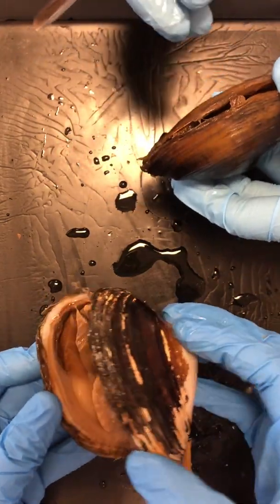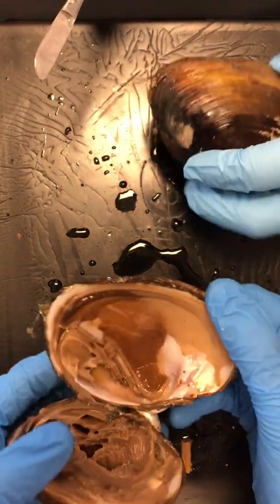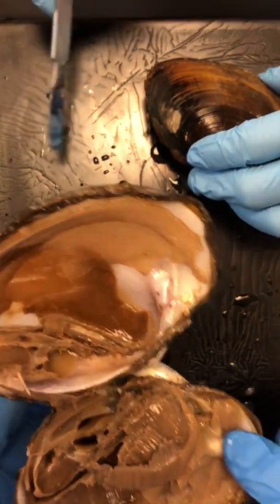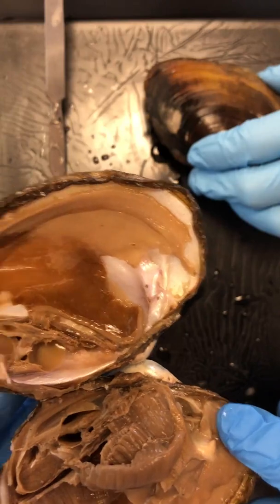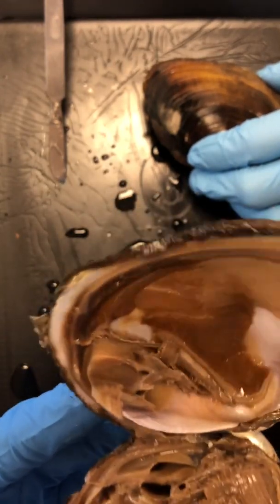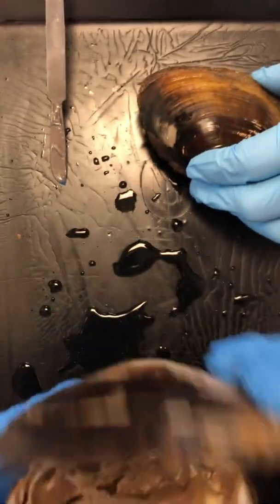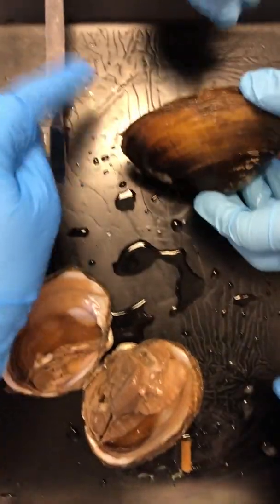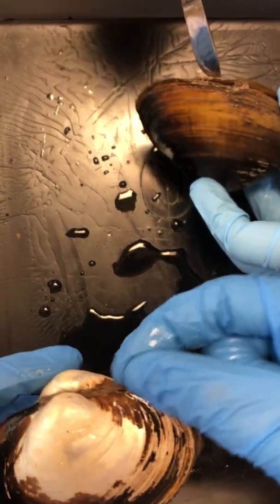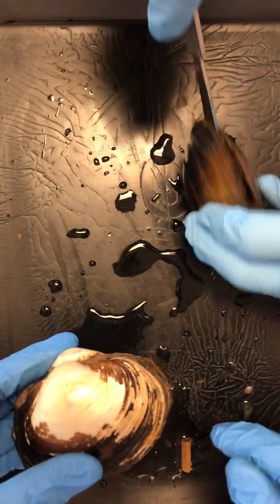So I've already sawed through mine because I came prepared, unlike some people. Just kidding, Coach is prepared. So here's one of those muscle pieces, and then here's the other one. They act like big grips that seal this guy nice and shut. So Coach, you're going to take this scalpel, and you're going to slide it through here and saw it towards the edge, away from your fingers.